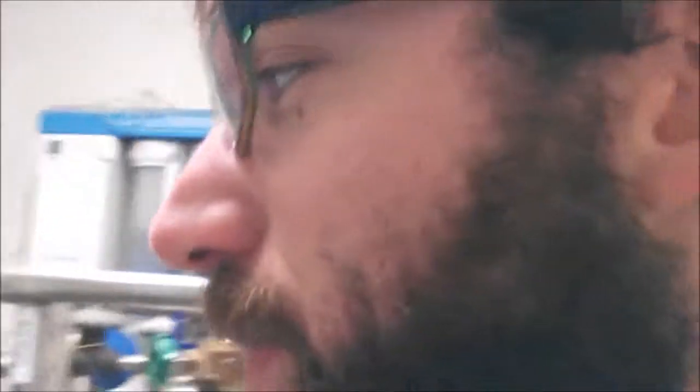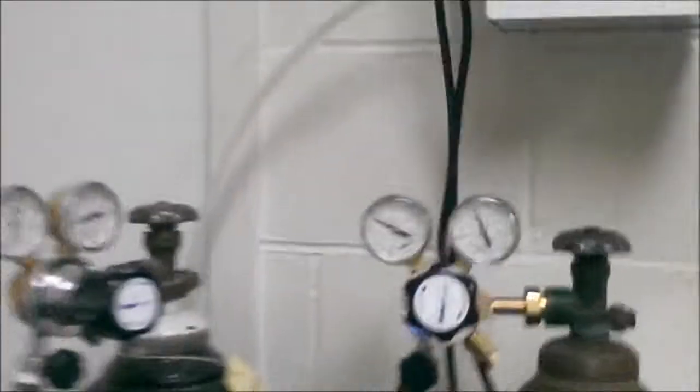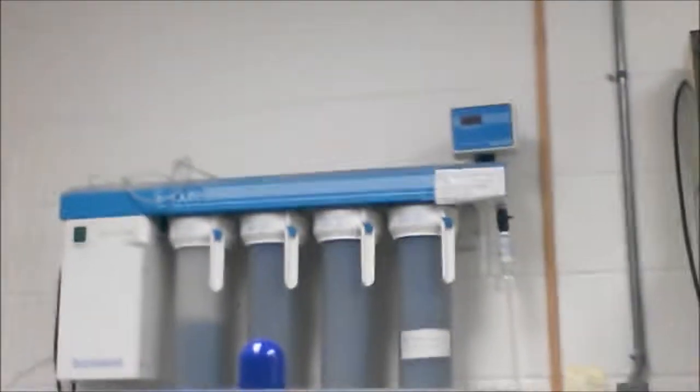So how do you start it? That's the question. We've turned on the argon, the machine is on, everything's running. Water cooling does not have a light on. There's a little light on the water cooler, which is in the back here — that machine right back there, that's the water cooler. If there was a light on the front and it was on, I would have to put more water in there. You'd want to use deionized water only, but there's a DI maker right there on the wall. So we're good.